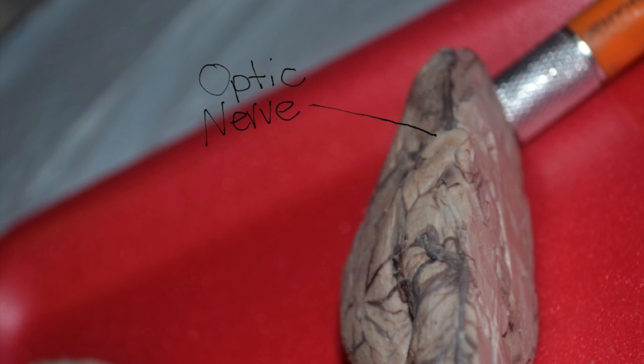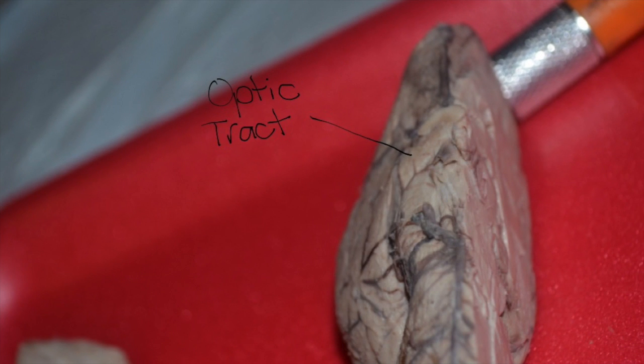Optic nerves are at the front of the brainstem. Most of the optic nerve is missing and only two small parts remain in preserved specimens like this. The optic nerve carries visual signals from the retina of the eye to the brain. The part of your brain that processes the image is actually located on the dorsal surface of the cerebrum. The optic tract is right below the optic nerve and disappears into the cerebrum. The optic tract is part of the visual system in the brain and is a continuation of the optic nerve. It relays information from your eyes to your brain.